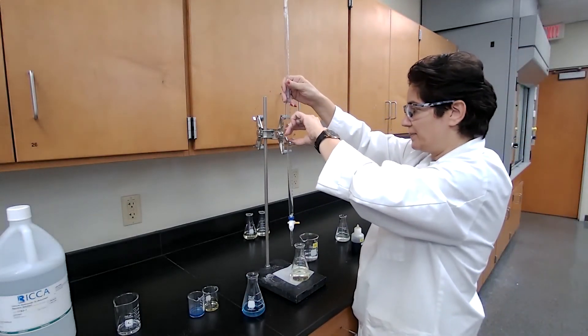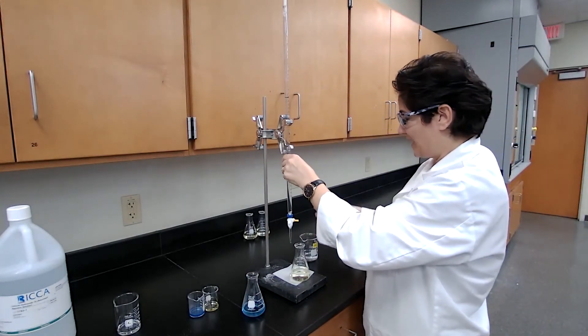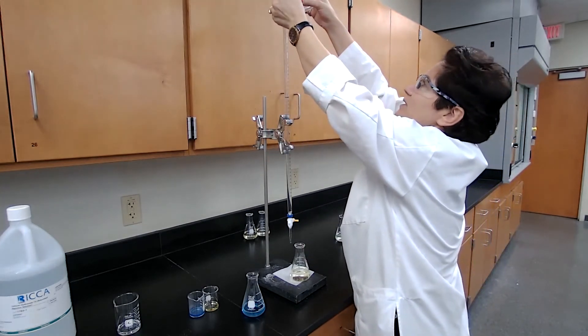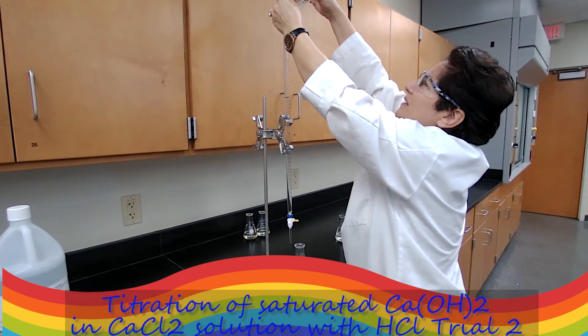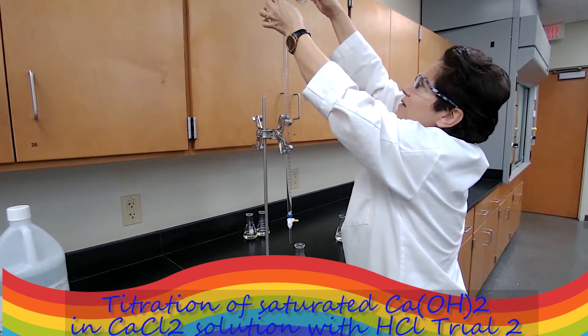So we are repeating the trial because we have to do at least two trials for titration. So I'm going to start with refilling the burette with HCl.